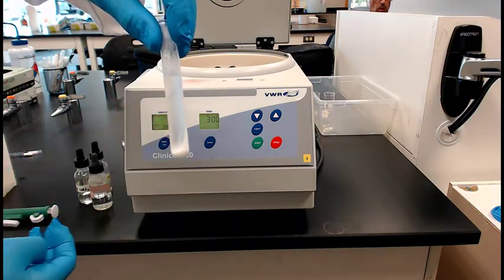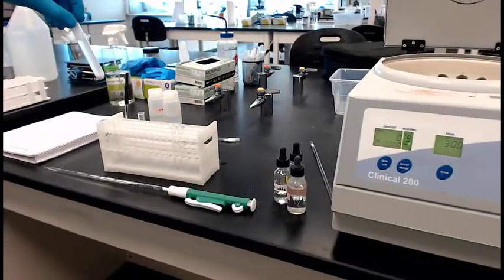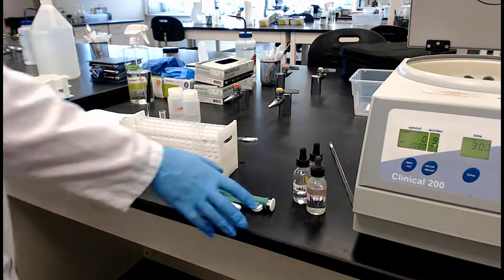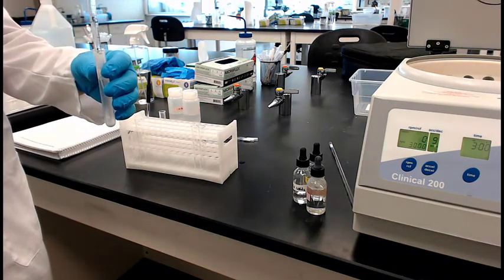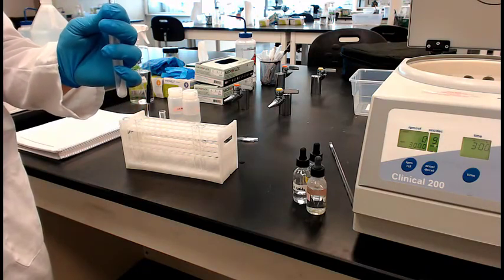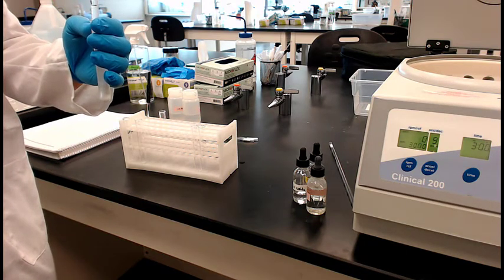All right. So at that point we just finished step 3. So now what we're going to do is reach in there and grab some of the, he looks like he's going for the fluid layer. Okay. Step 4, draw the clear filtrate, the clear fluid.